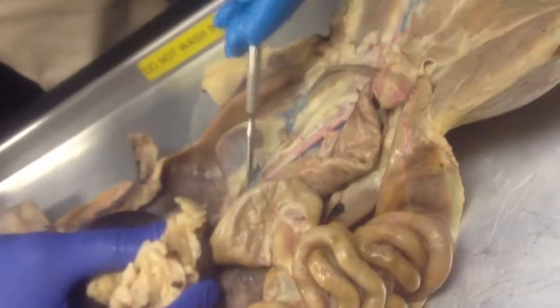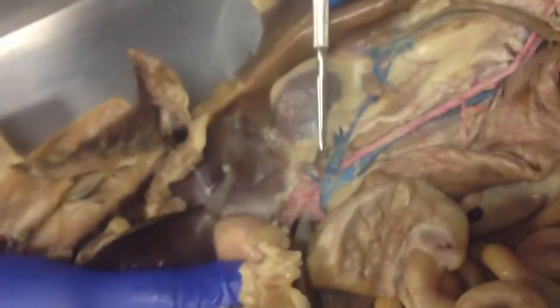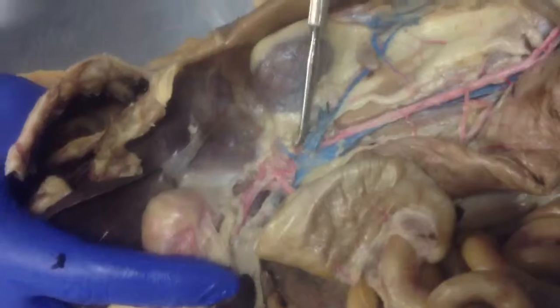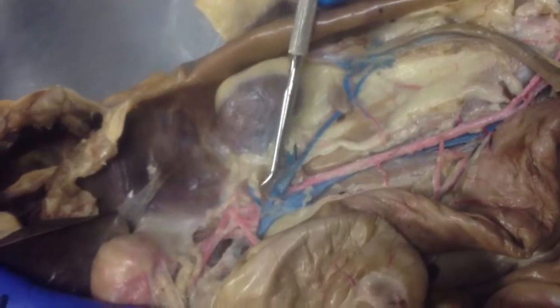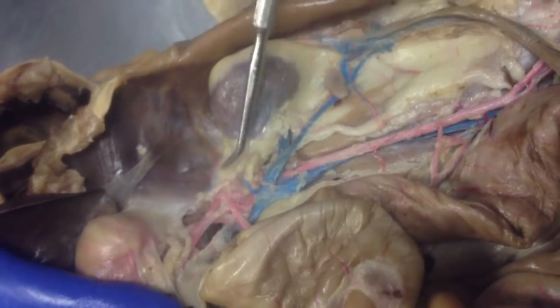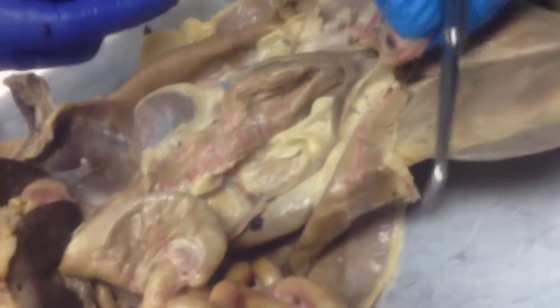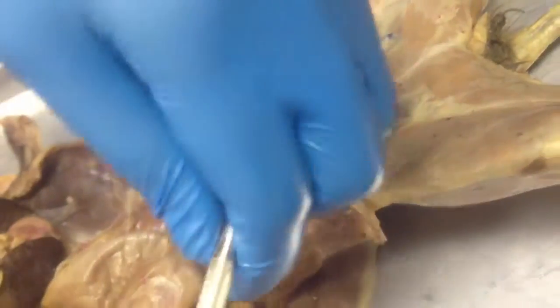We have here a kidney, on both sides, kidneys, and medial to the kidneys we have the adrenal gland. This here, the adrenal gland. So as opposed to human, where it's sitting right here above the kidney, here it is medial to the kidney. That's the adrenal gland. And down here we have the bladder. So it's small in this case here, but in this cat here we can see a bigger bladder.